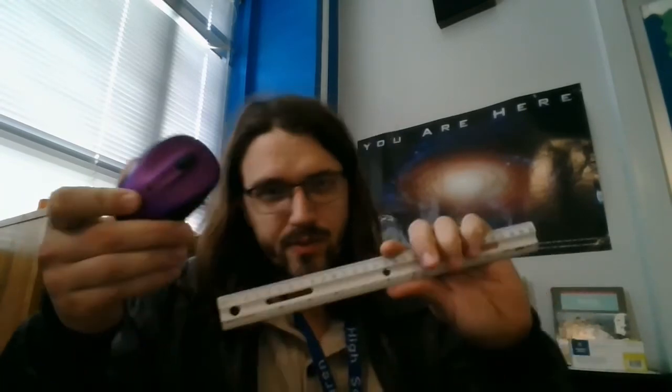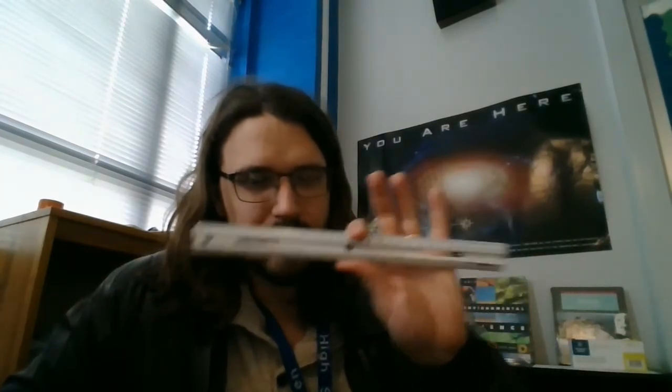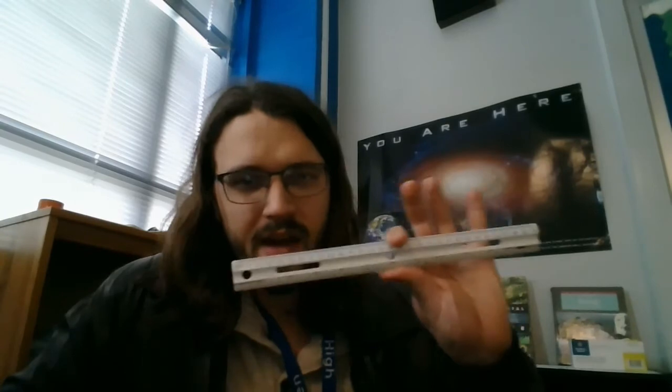For example, if we wanted to measure how long this mouse was, we could just line it up to a ruler. We can do the same thing with a digital recording where we put a ruler over the top of whatever microbe we're trying to measure and figure out just exactly how big it is. And knowing how big it is will help us identify the microorganism that we find.